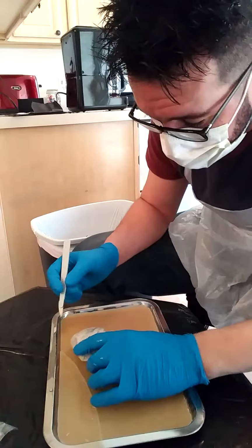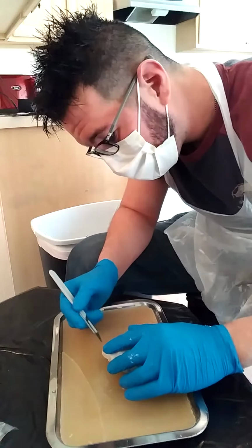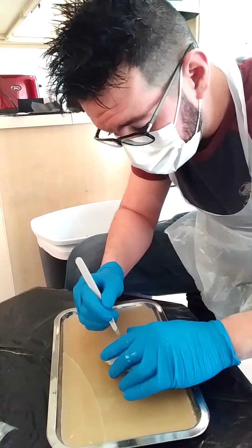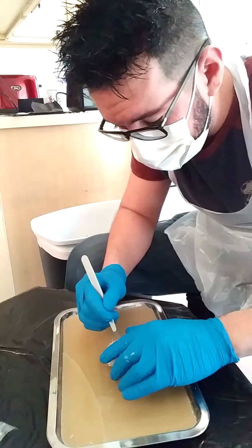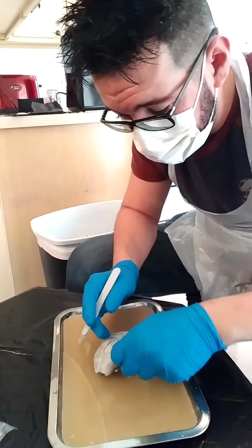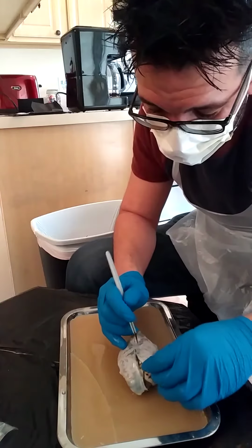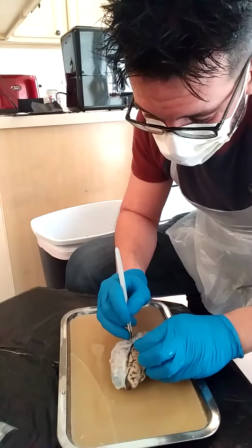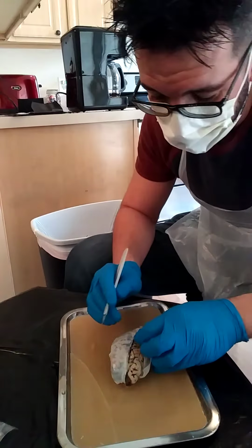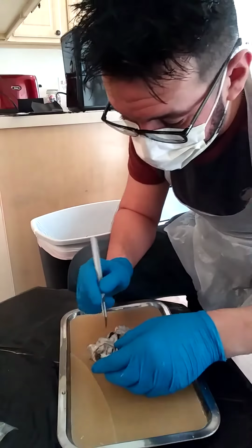Trying to get rid of the dura mater here.